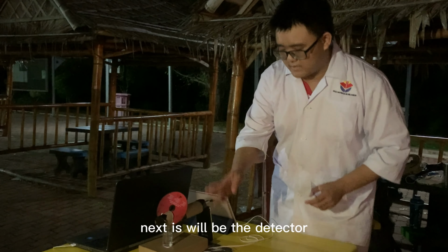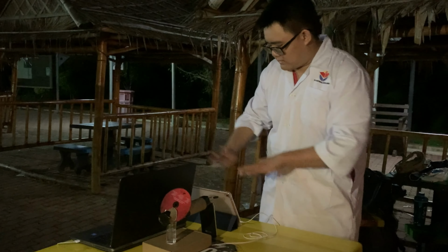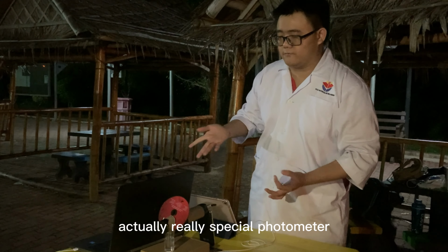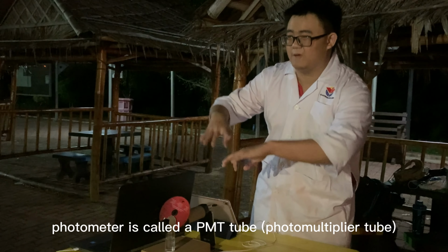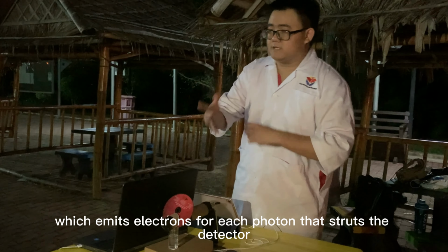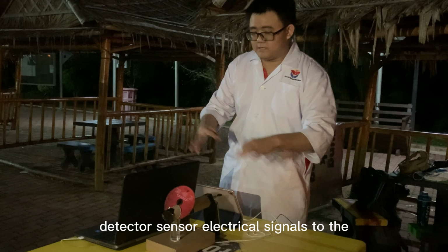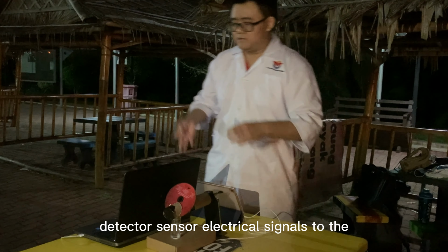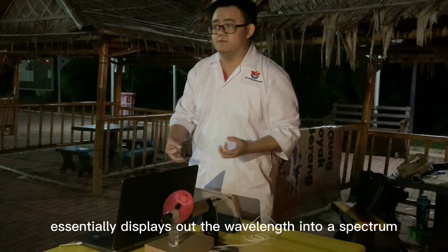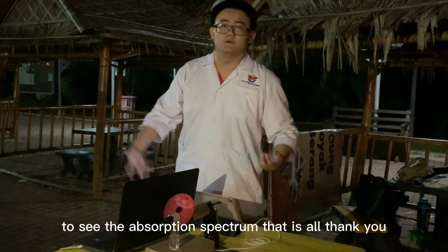Okay, and next is the detector, which is this cardboard box over here, as well as a device over here. In an actual UV spectrophotometer, it is called a PMT, a photomultiplier tube, which emits electrons for each photon that strikes the detector, and the detector sends out electrical signals to the processor and readout device. The processor and readout device essentially displays the wavelengths as a spectrum for us to see the absorption spectrum. That is all. Thank you.